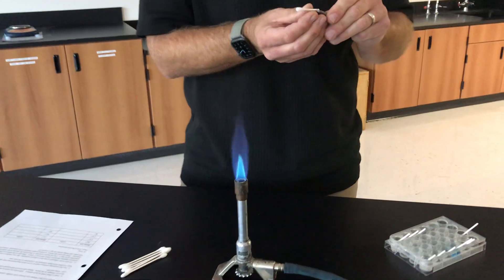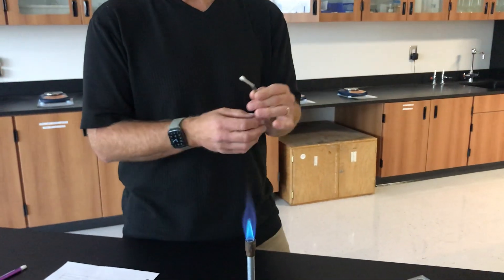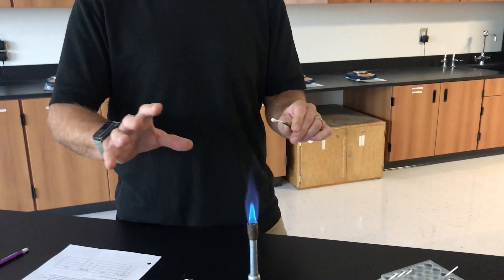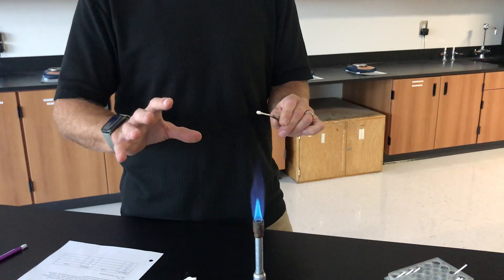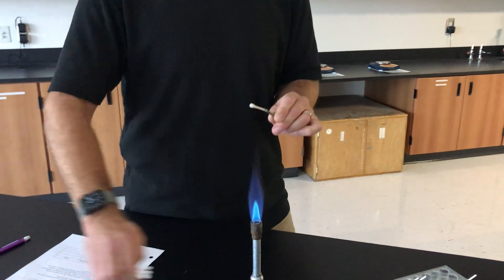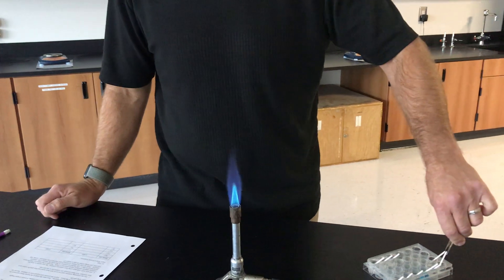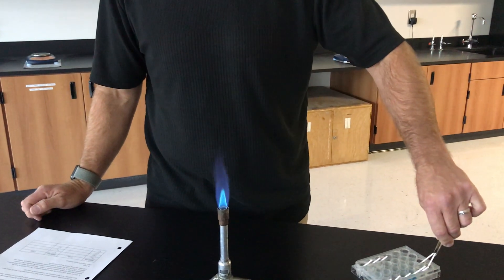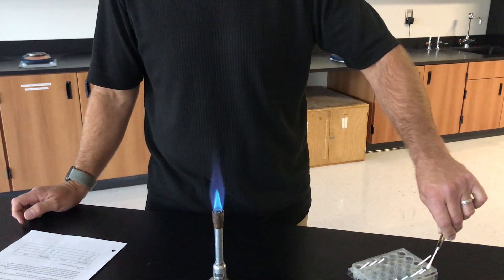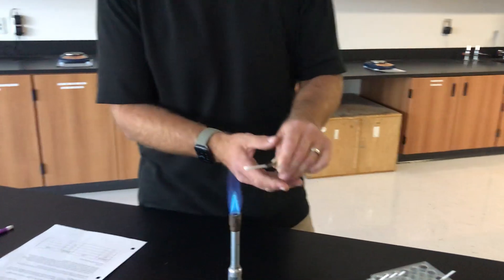You'll notice we are going to place the Q-tip, which is soaked in these ion solutions, in the flame. What we'll see at first is a yellow color as the water boils off of the solution. The color that we're looking for then is the color that follows after the water is gone.